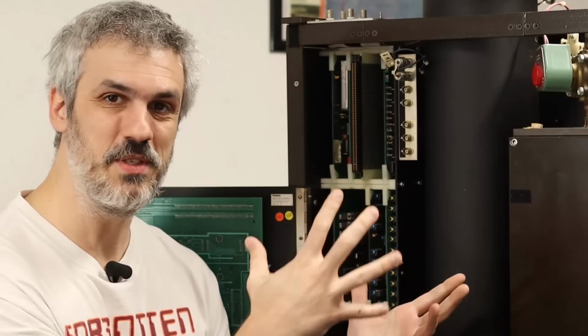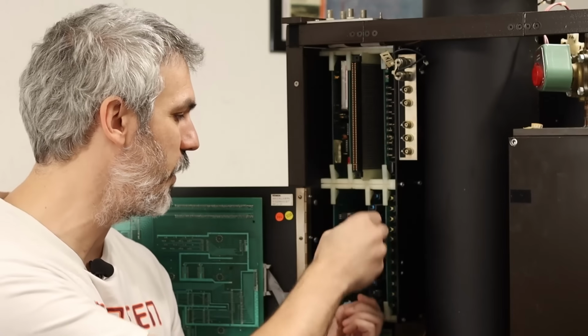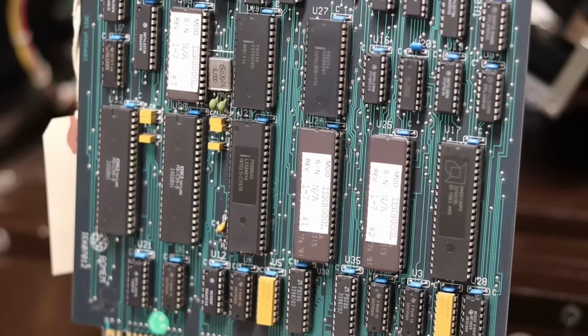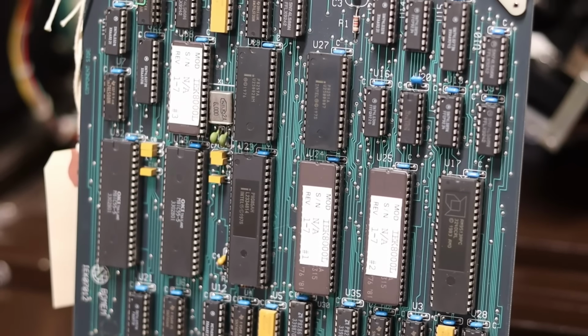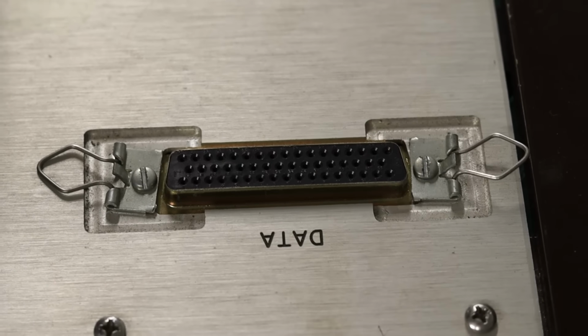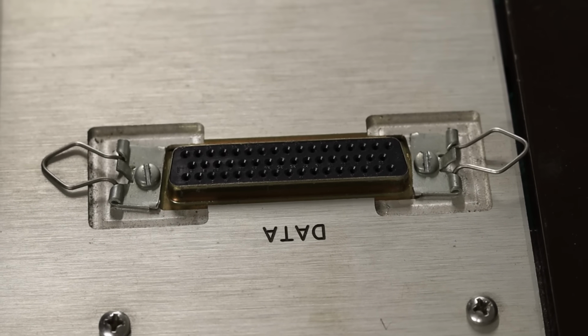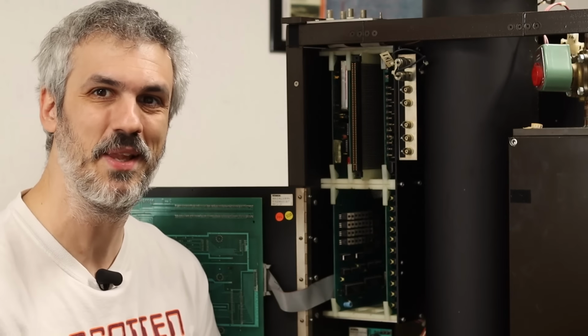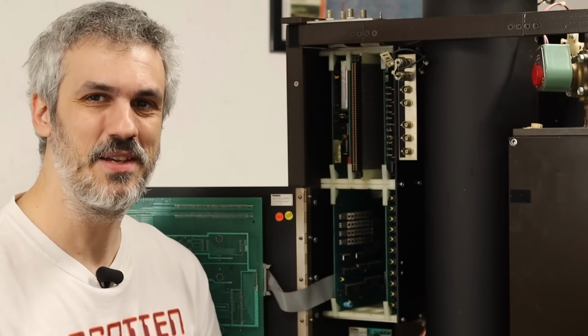Now, this DA-3 has a full-fledged computer in it here, and actually the main processor board, which is this one right here, is based on an 8085. So this thing has a whole lot of smarts in it, but it does need something to control it. And there's a massive plug on the top, a 50-pin D-shell connector that's going to go over to the PDP-1173, but therein lies some difficulty.